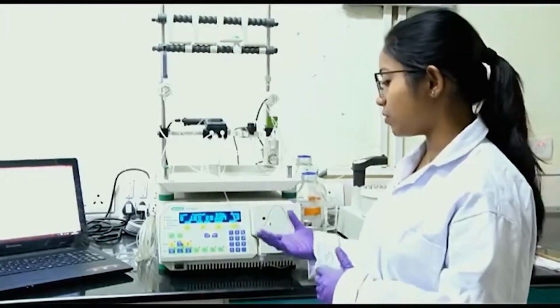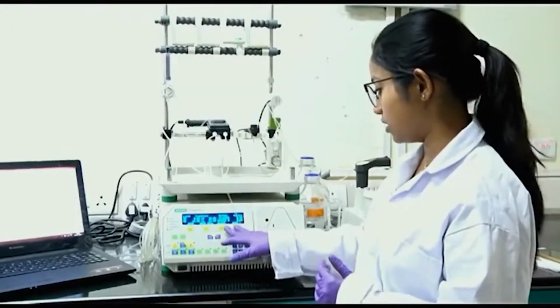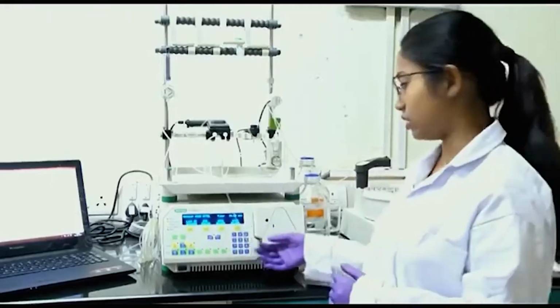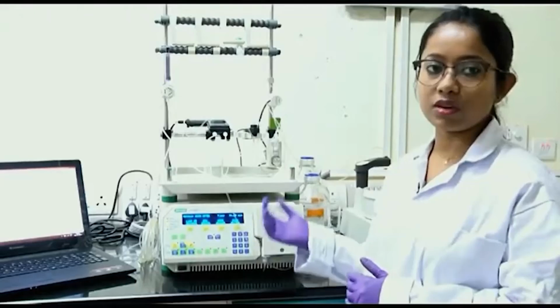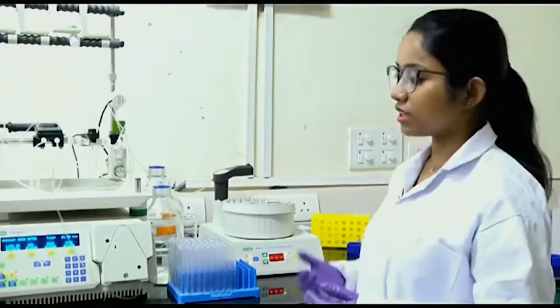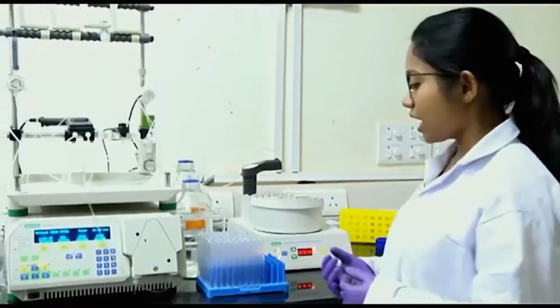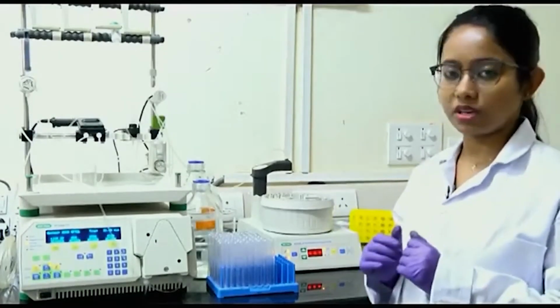If you have a higher amount of protein or a higher column volume, then you can modify these measurements. Now I am done with this method and I will start running it, where it will take buffer A and buffer B, and we will also monitor what is happening to our protein of interest. Before we start the program, another thing we need to do is collect all the fractions. As I mentioned, in this step my protein will come out from the column, and we need to make sure in which fractions, or in which particular volume, my protein is coming out.